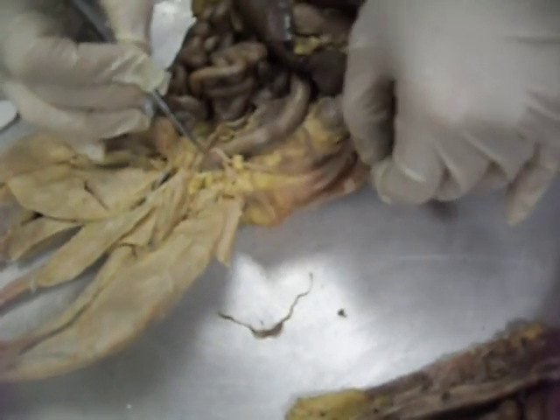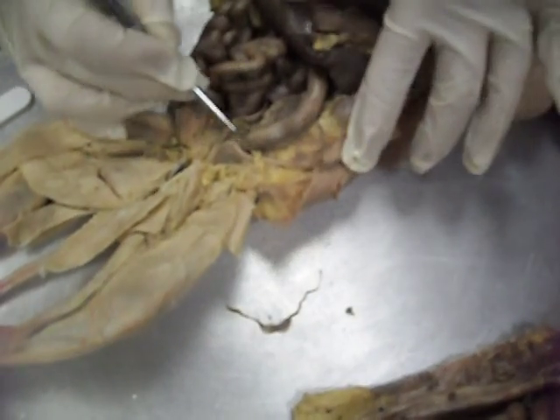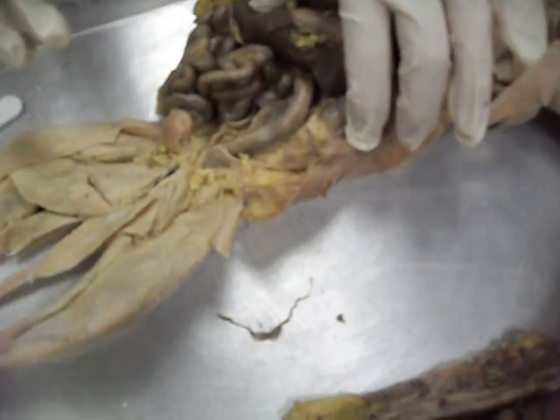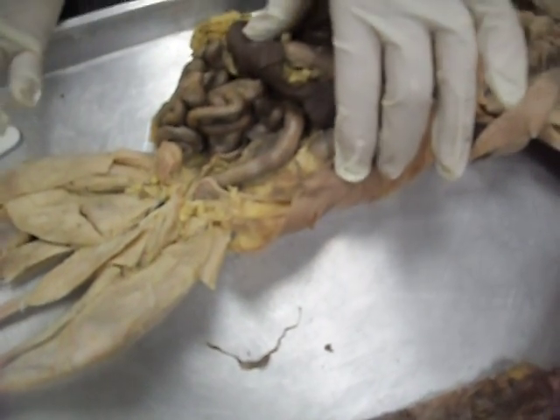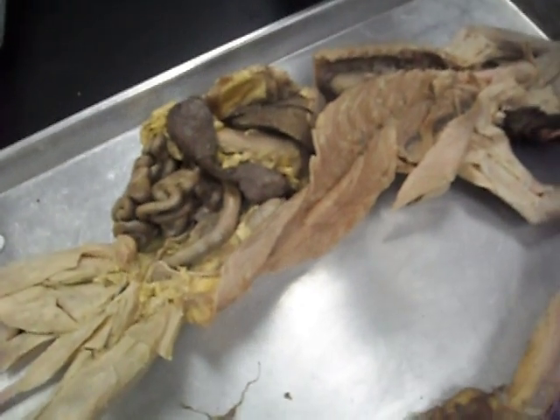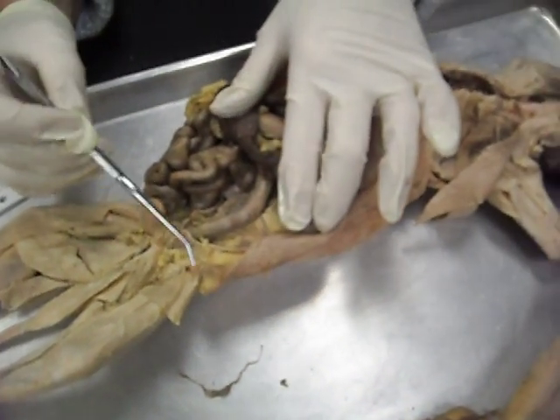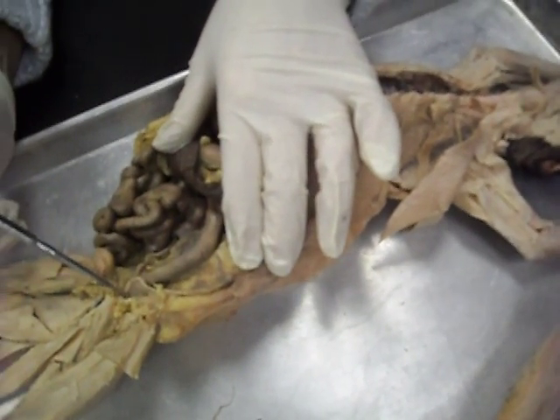This is the uterus — this is the body of the uterus. And these extend to what's called the horn of the uterus, because unlike the fallopian tube, it can support the growth of a developing embryo — cats have litters. We didn't have any pregnant cats this semester, but you could have kittens all through this area.